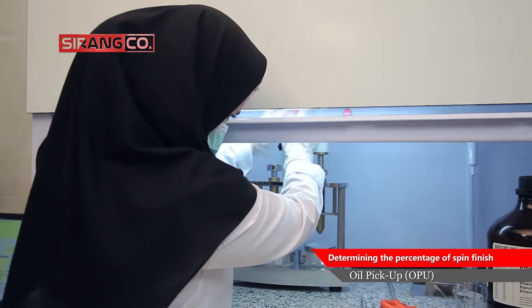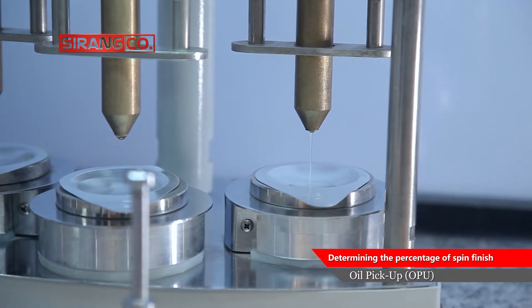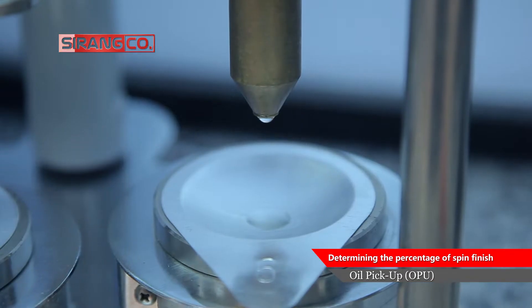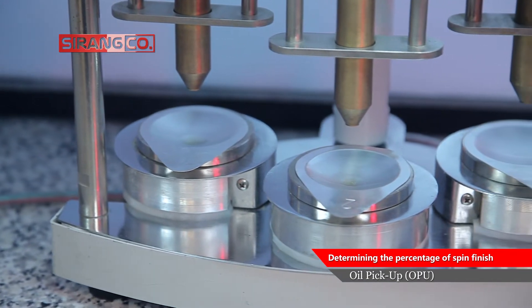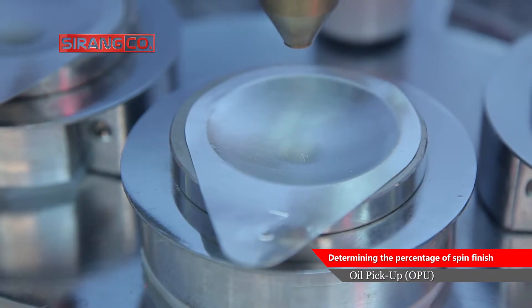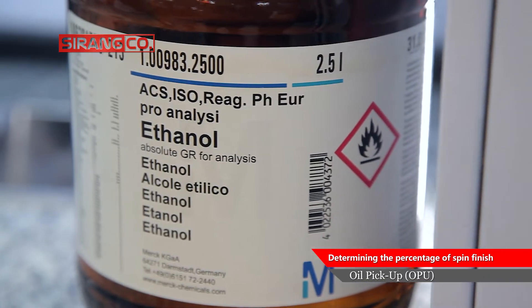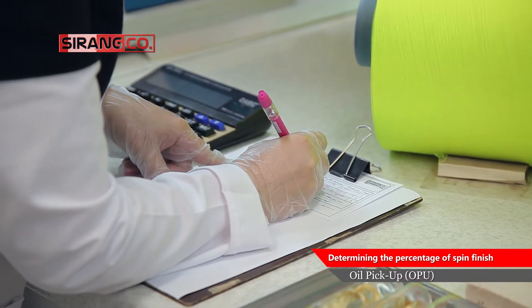After that, using a compression rod, the solvent containing the oil is removed from the tube and poured onto a small aluminum container whose weight has already been recorded and is being heated. This temperature is adjustable and causes the solvent to evaporate. The last to remain in the container will be oil. These steps are repeated by pouring the other two series of ethanol, and at the end, after cooling the container, the remaining oil is weighed.